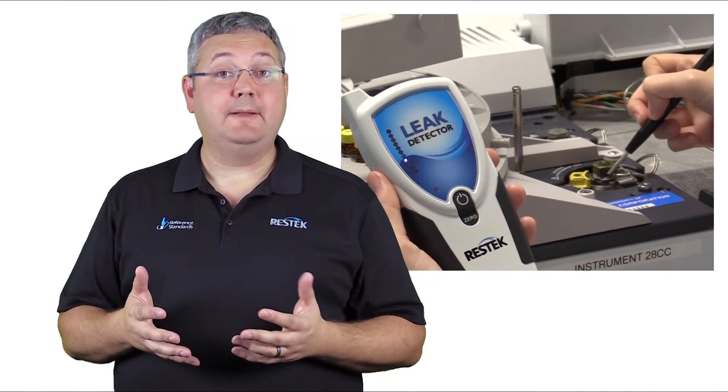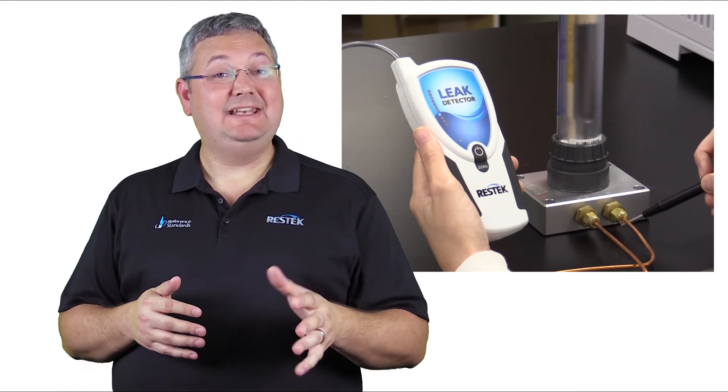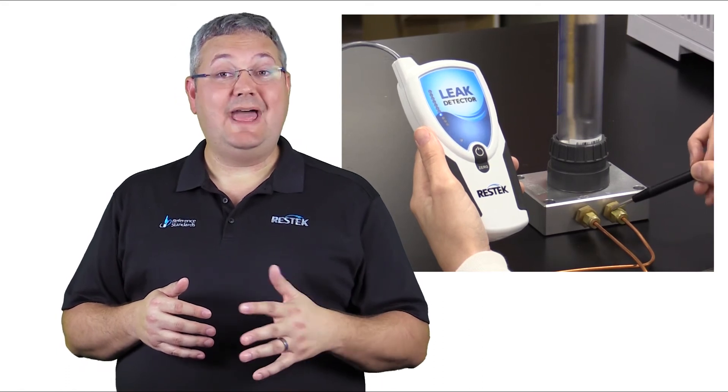If we get back to the oxygen problem though, that's something that we want to always keep in our minds. We always want to be leak checking our GC systems. We always want to be making sure that we are scrubbing oxygen from our carrier gas. Having some type of inline filter to remove that is really important.